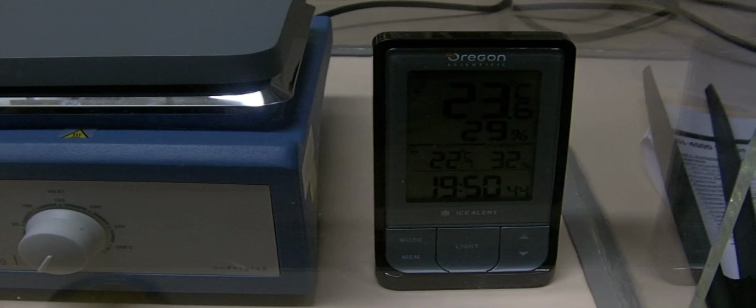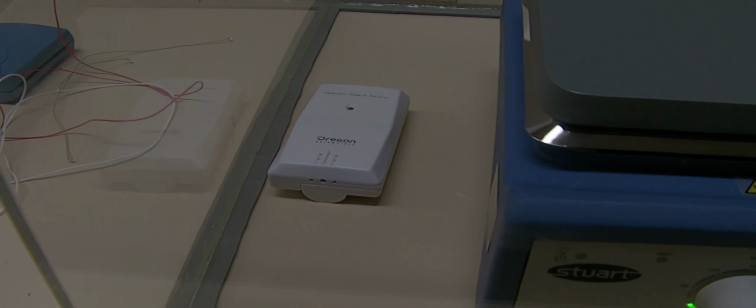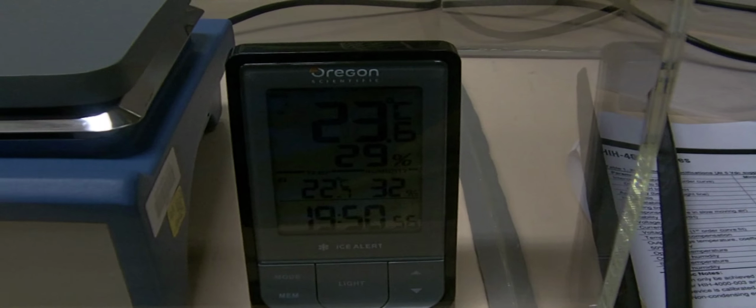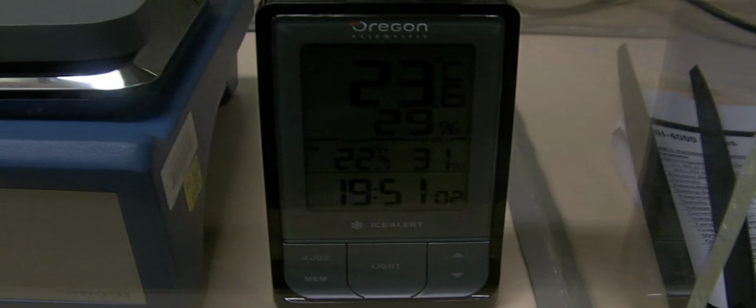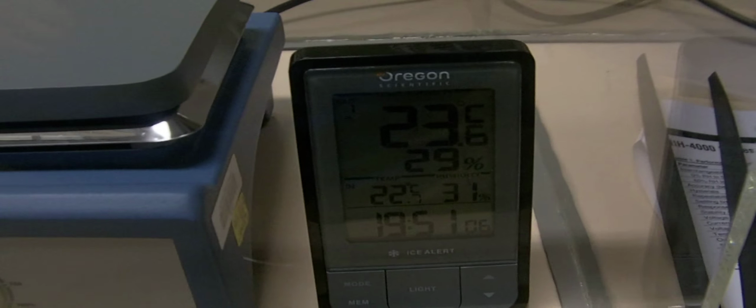Okay, so here is the new temperature sensor. And in fact, we actually get one for free because this is designed to be used both indoors and outdoors. So there's a remote sensor. The top row is the reading from the temperature and then the humidity in percentage below it on the left-hand side of the desiccator. And then the second line down is the temperature and humidity on the right, which actually gives us more information than we had before. Excellent.